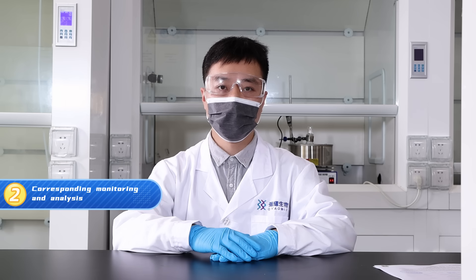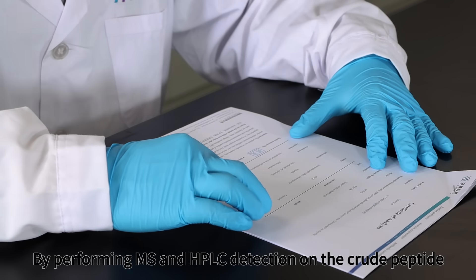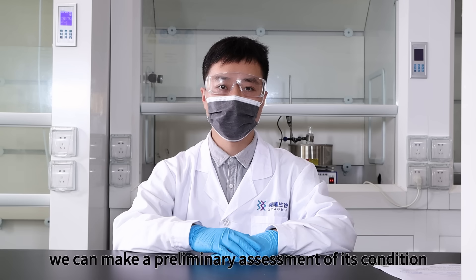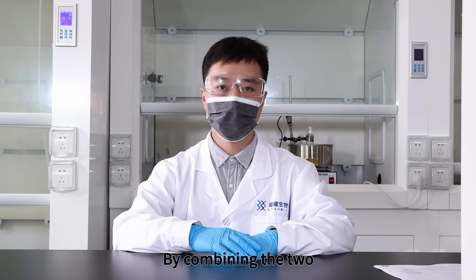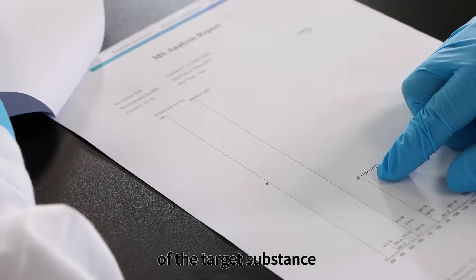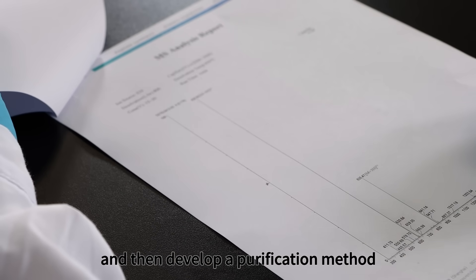Step 2: Corresponding monitoring and analysis. By performing MS and HPLC detection on the crude peptide, we can make a preliminary assessment of its condition. By combining the two, we can roughly determine the peak position of the target substance, and then develop a purification method.